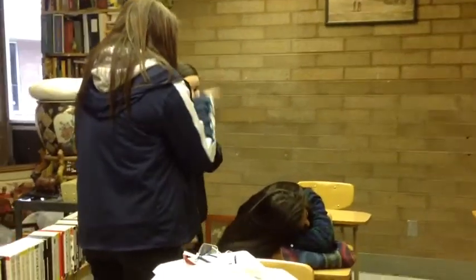There is absolutely no horseplay in a lab. It's not funny, Steph.